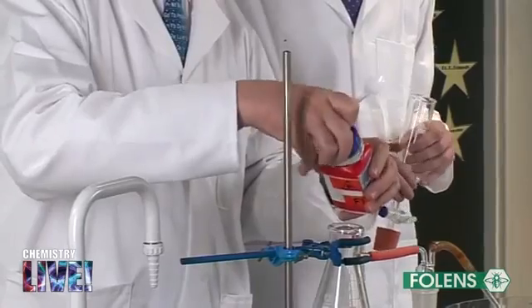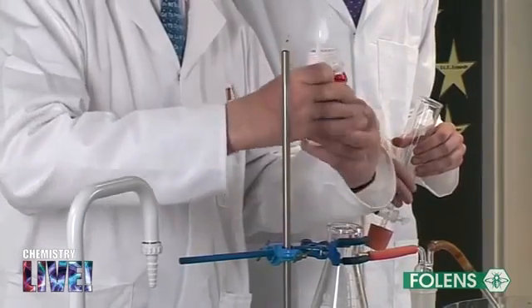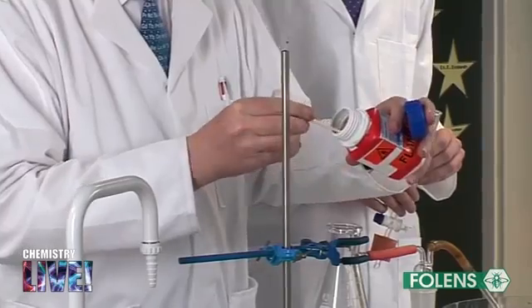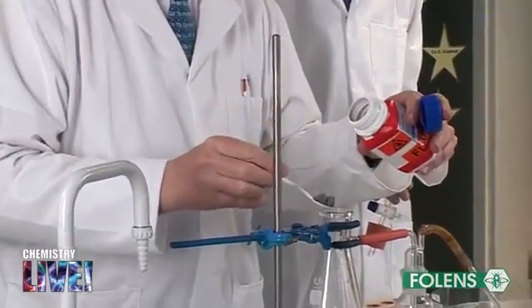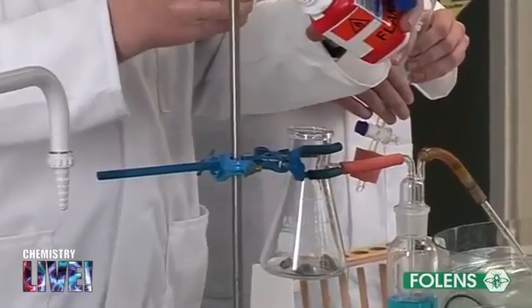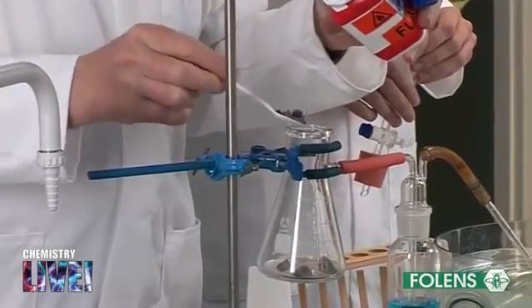No naked flame should be brought anywhere near the gas preparation apparatus. Ethyne gas forms an explosive mixture with air. Tests on the gas should be performed well away from the apparatus.